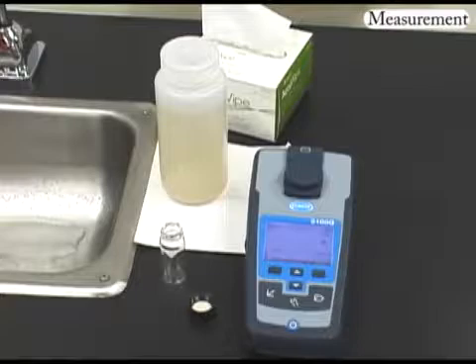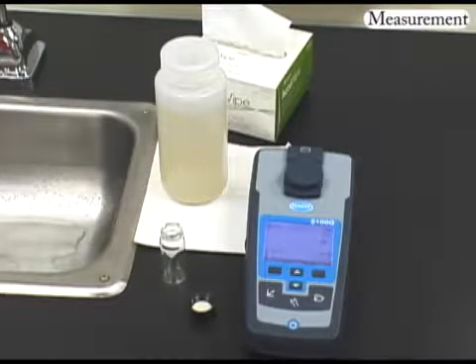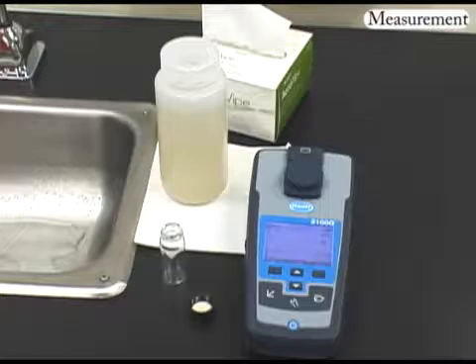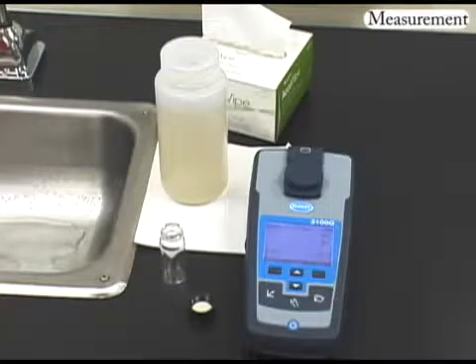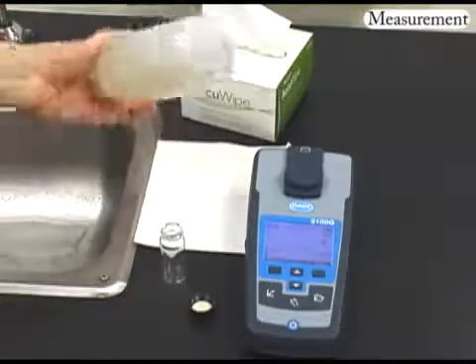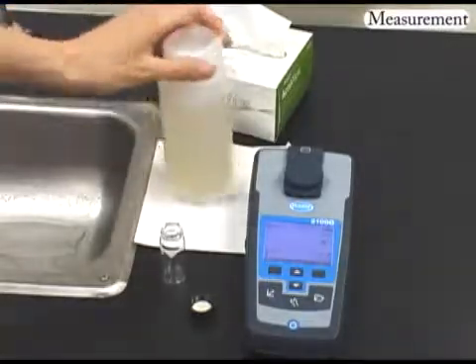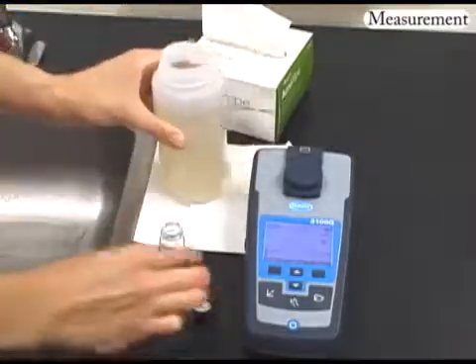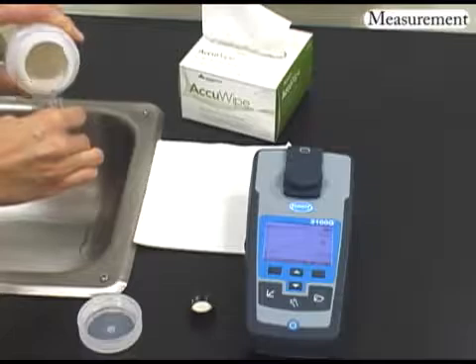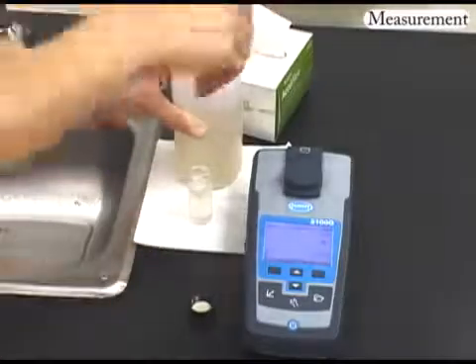Samples should be collected in plastic or glass bottles. All bottles must be thoroughly cleaned, rinsed with turbidity-free water, and dried prior to use. Volume collected should be sufficient to ensure a representative sample, allow for replicate analysis if required, and minimize waste disposal. Before pouring the sample into a sample cell, invert the sample bottle several times to ensure a homogeneous mixture. Do not shake the sample to mix, as this may introduce bubbles. Immediately after mixing, fill the sample cell, then dump to waste. Repeat this a second time, then fill the sample cell a third time, being careful not to introduce air bubbles, and screw on the cap.